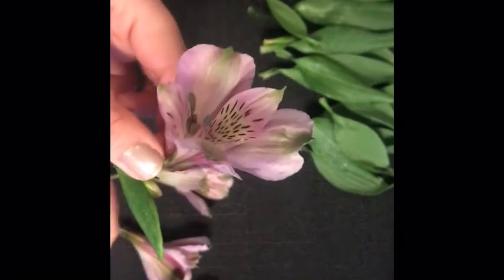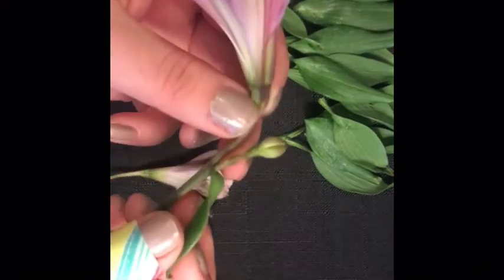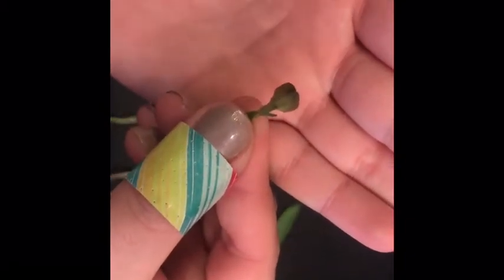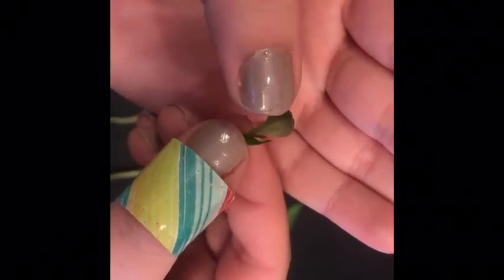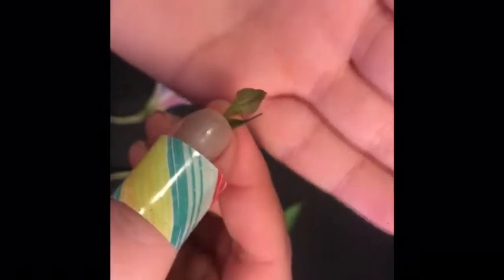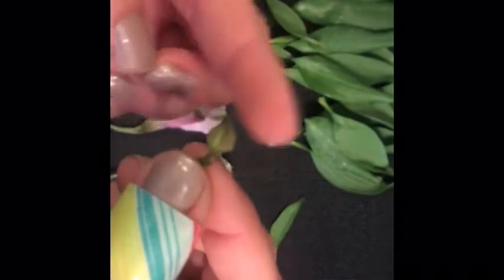Here on our flower, we have a bud, which is a new flower that'll join. And I wanted to show you that because there are two things happening here. On our bud, hopefully you can see, we can't see the petals just yet. And this part is called the sepal. And the sepal protects the flowers as it's growing and also the reproductive parts inside. So right now the sepal and the petals that are forming are very small. But actually these parts don't go away.